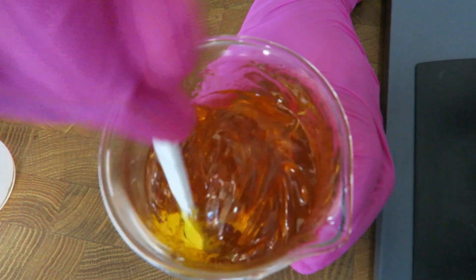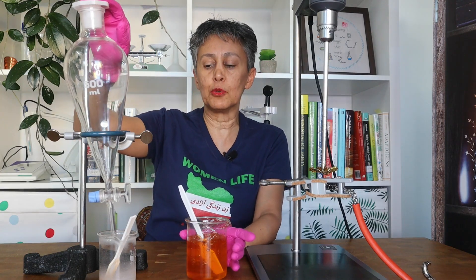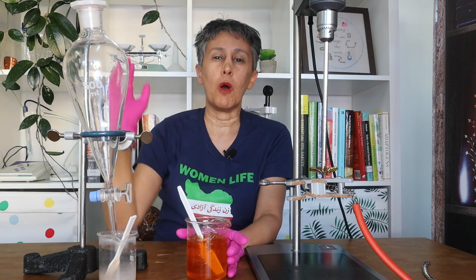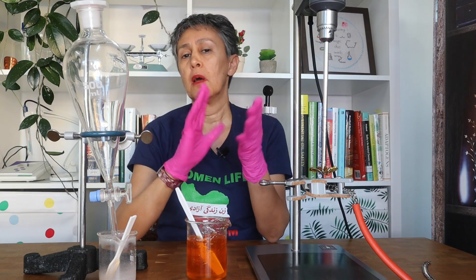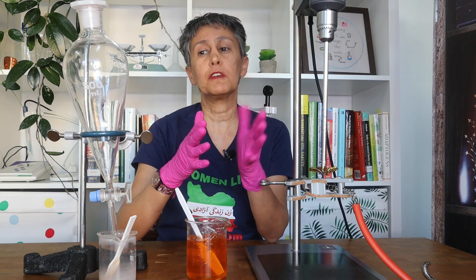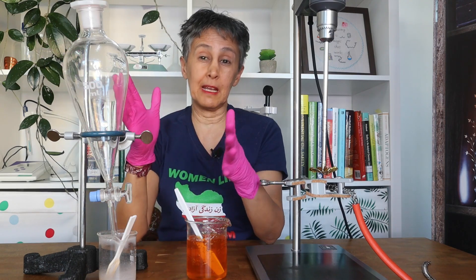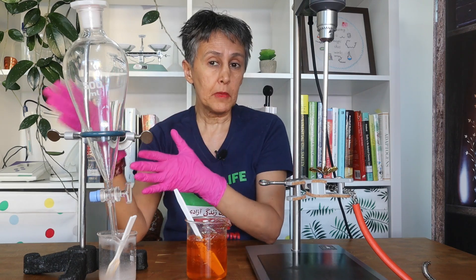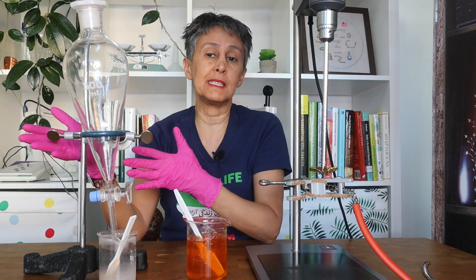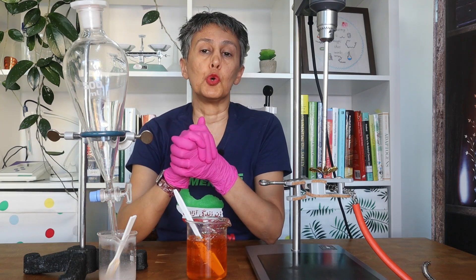This is the setup — it is very easy to clean and to disinfect. If you are going to produce larger batches, something between 100 grams to 2 kilograms, even up to 5 kilograms, you can create such a setup. It is very artisanal but still much cheaper than a pumping system, and it works perfectly. I wish you good luck!